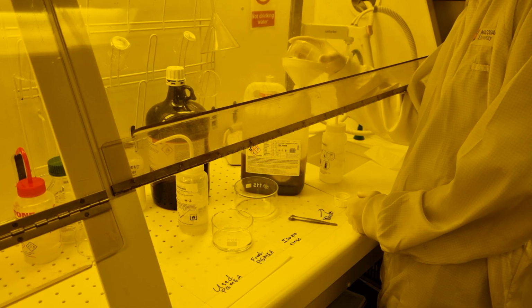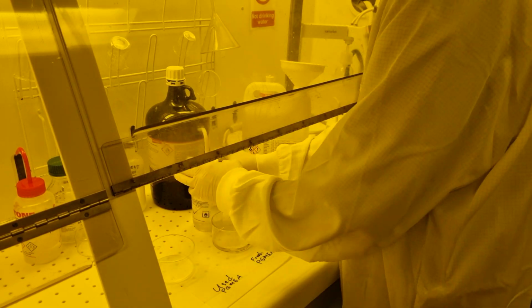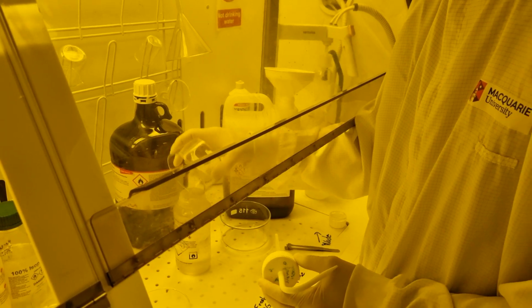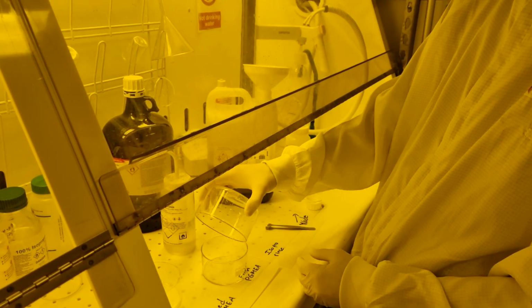To clean up, pour the heavily soiled first bath of PGMEA into waste. Pour the lightly used PGMEA into the yellow squirt bottle for reuse, and clean all dishes with isopropyl alcohol.